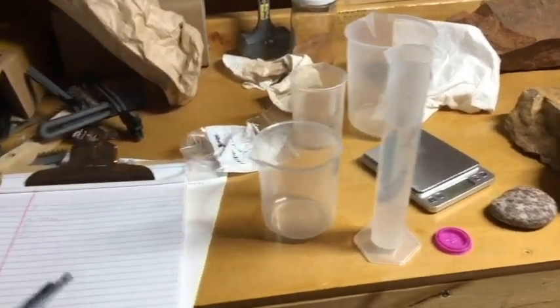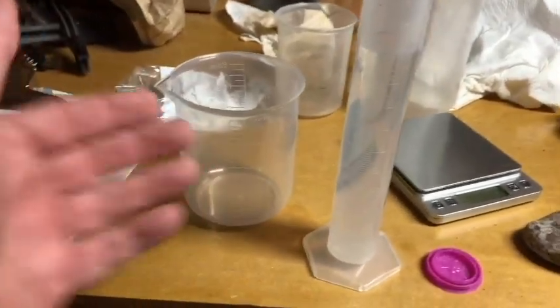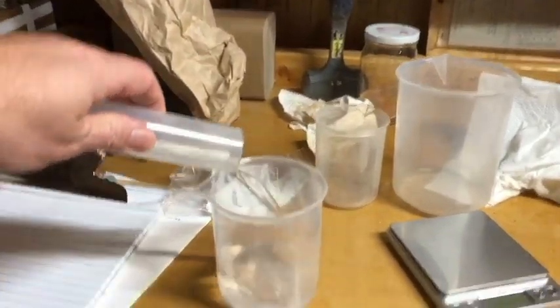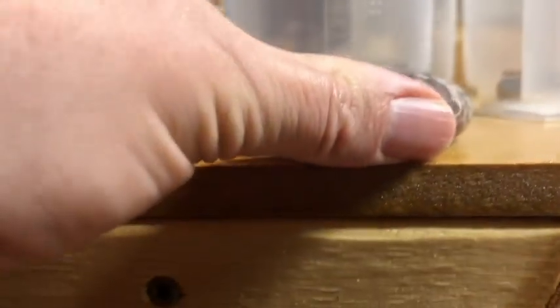What I'm going to do to fill this beaker with my initial volume is use this graduated cylinder because it's more accurate than this one is, and I have 100 milliliters in there right now. So we'll put that in. That will not be enough. You can see this beaker is pretty close, but that's not going to be enough, so I'm going to put in at least another 100. Well, actually, maybe 50 will do.